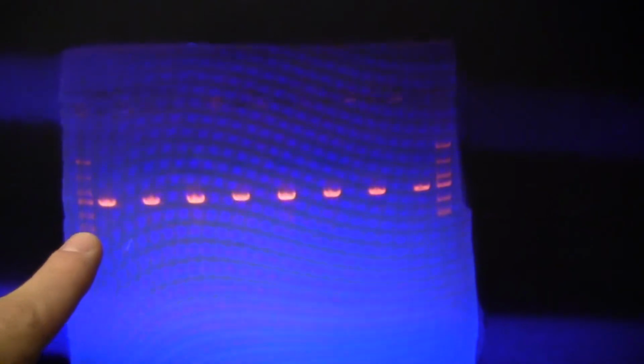So I ran the gel and I actually just sent a picture of it to myself. It's on my computer now. So we're just looking at that gel. I'm just going to point out some of the features. So we have our ladder there, and then it was 8 different PCRs, so you can see all of our bands. And they're all the same size. Unfortunately, they are the wrong size.